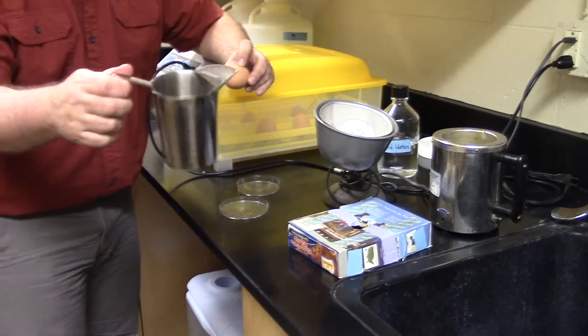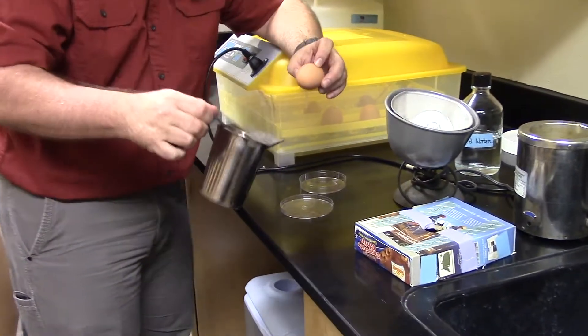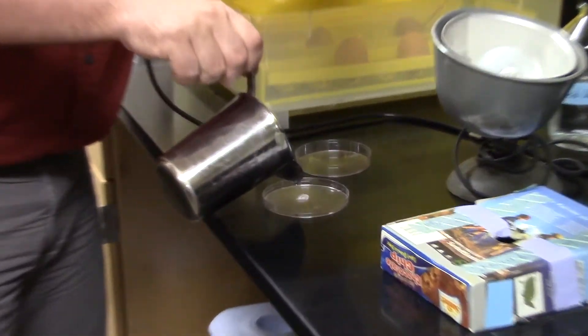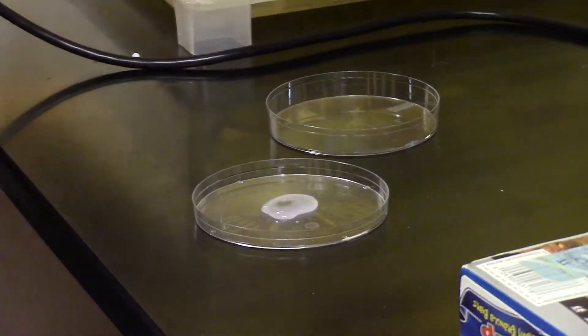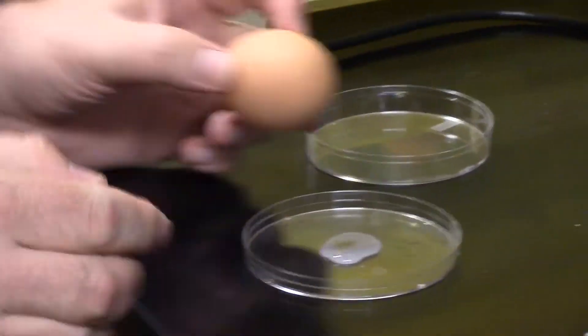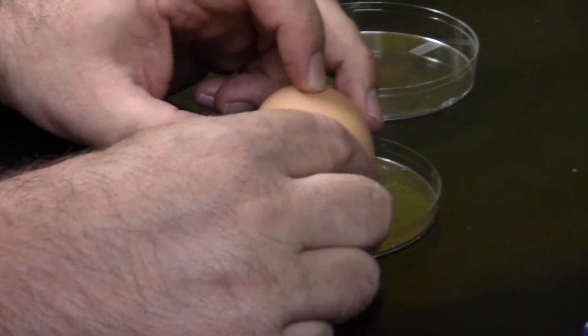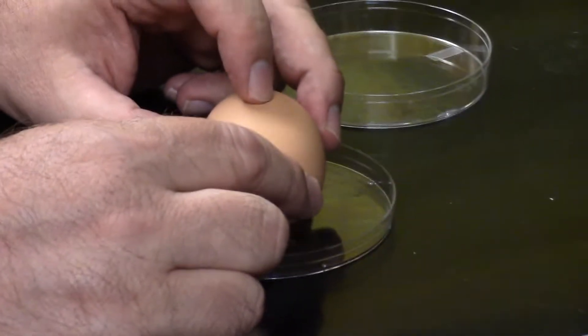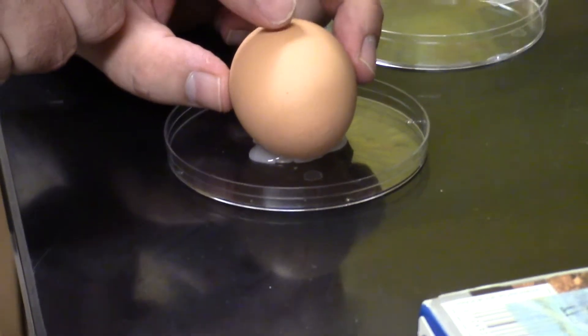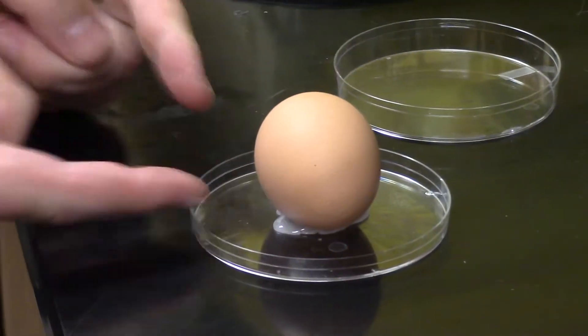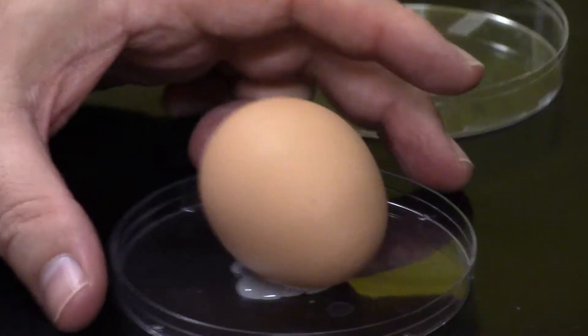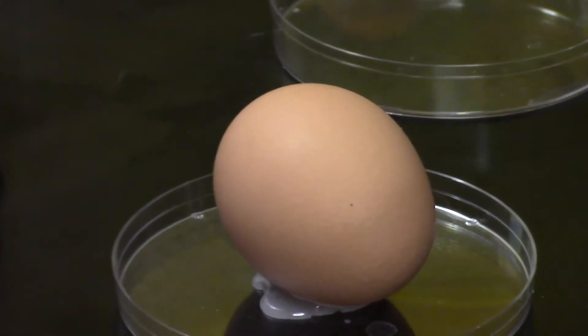I've got some melted wax in here, and I'm going to pour about a quarter size, in other words a 25-cent piece of wax. As that wax is cooling, I've got my finger right where the embryo is, and I'm going to try to put that straight up and down. So the embryo is now sitting at the top, and my wax is cooling, allowing me to carry this to our microscope.